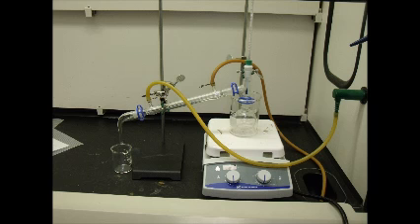First, place a large beaker on a hot plate in the hood. Then place the round bottom flask in the large beaker and fill up that beaker to the midpoint of the round bottom flask with water.